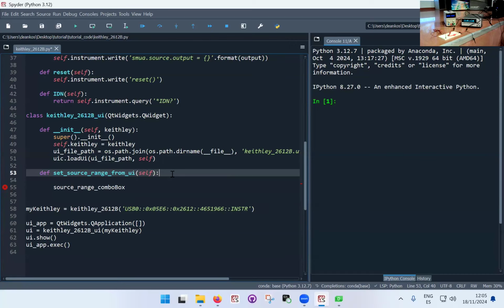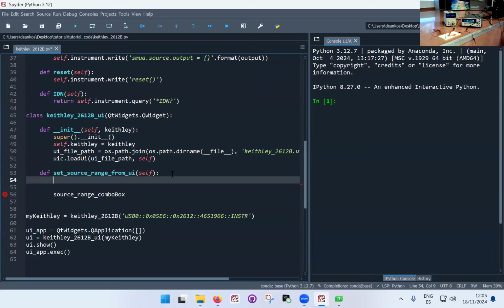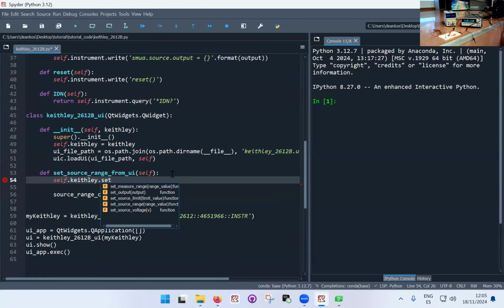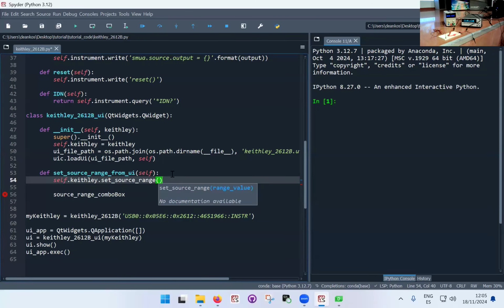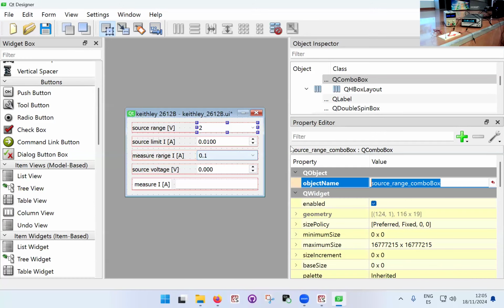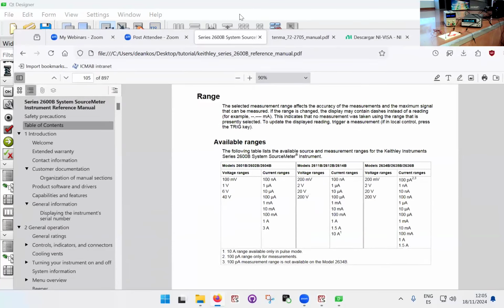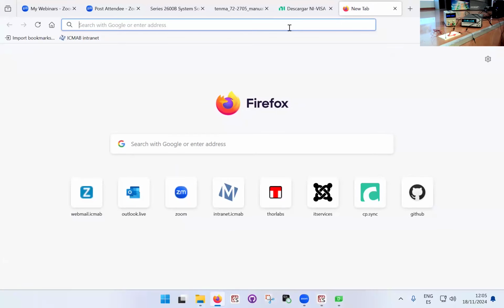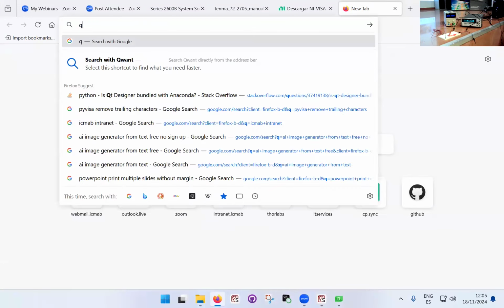And this also has to belong to the class. I'm going to put this self attribute, and here I'm going to go for self Keithley dot set source range. Okay, and here I have to put the value that's in the box. How do I access this value? Well, we need to know the way to access it. Well, the proper way, because you don't know in principle how this is done, is that you go in the Qt documentation, which is always very enjoyable. So you go to PyQt or just Qt.